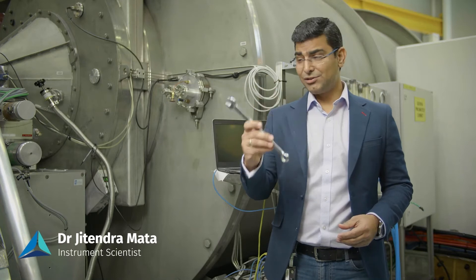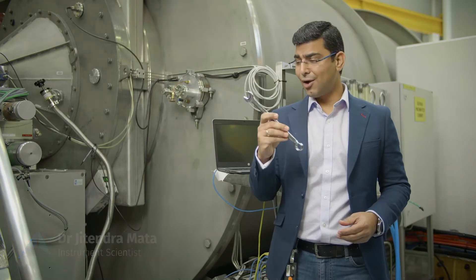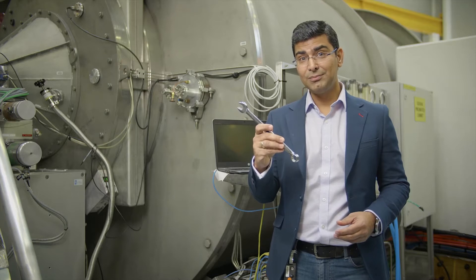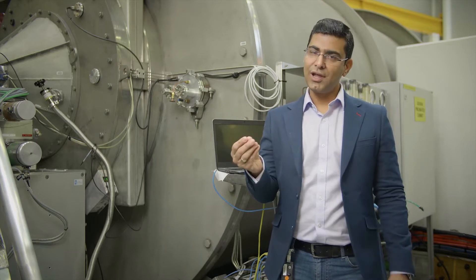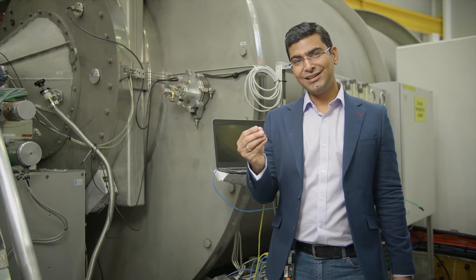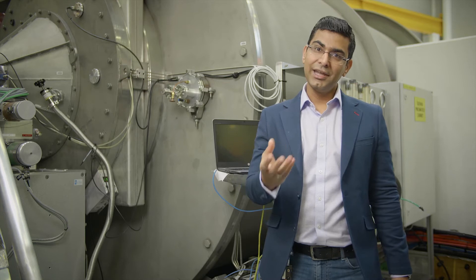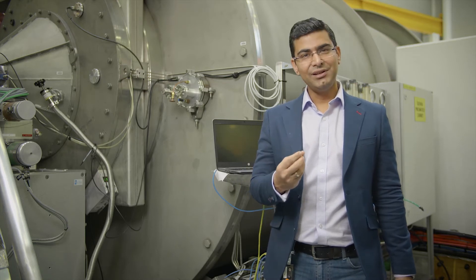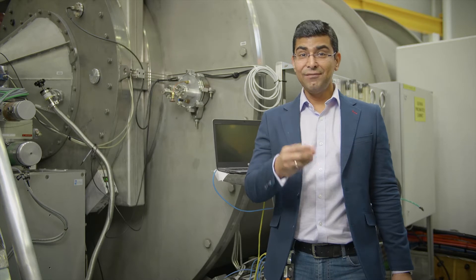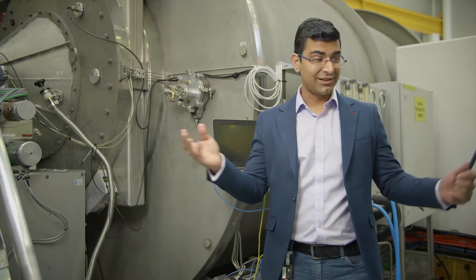When you hold any material in your hand, have you ever wondered how it looked like under a very powerful microscope? Or when you wash your hand, have you wondered how detergent cleans the dirt? Or if you drink milk or eat food, have you wondered how it gets digested in your stomach? If you answered yes to any of these questions, then you are at the right place.